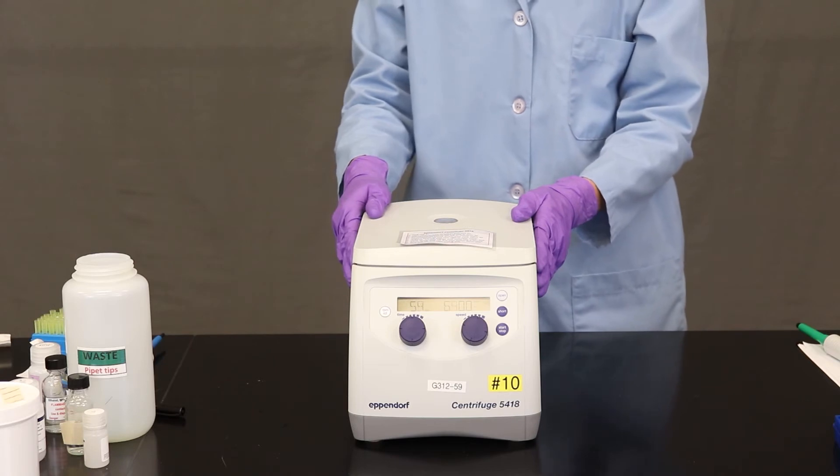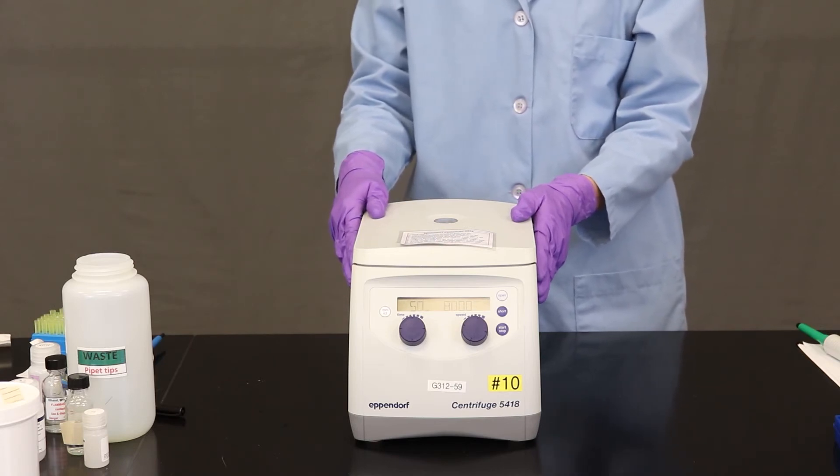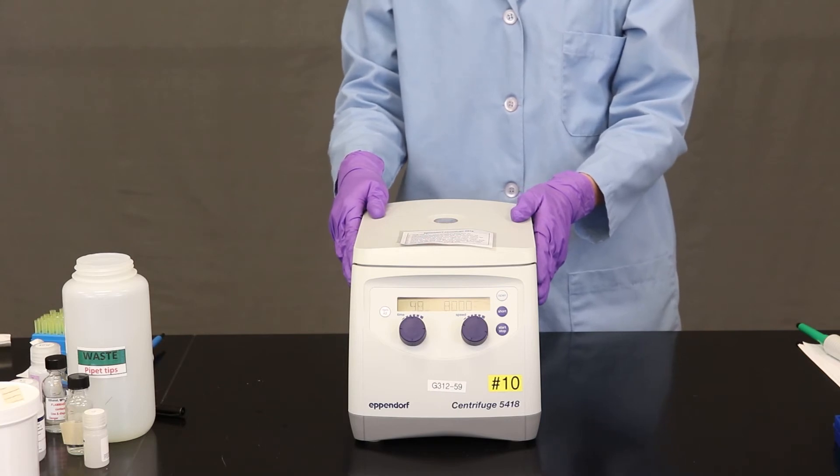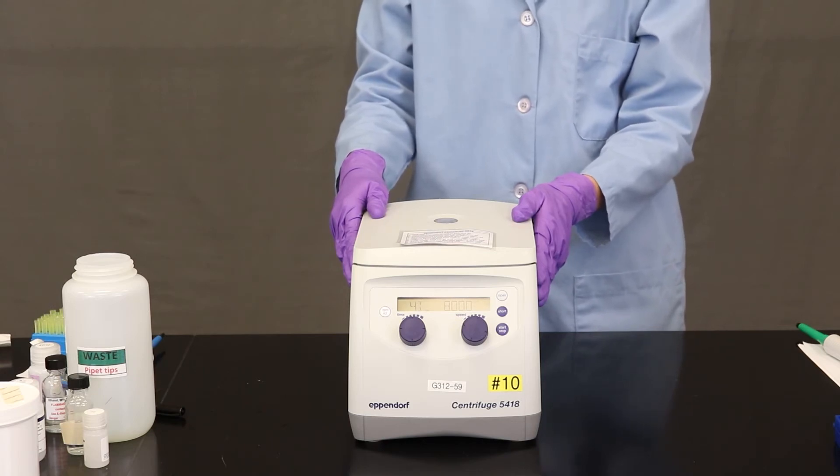So one thing with a centrifuge you want to listen for is quiet. If you ever hear a centrifuge be loud, that probably means that it's unbalanced. So listen to make sure that it's running properly.